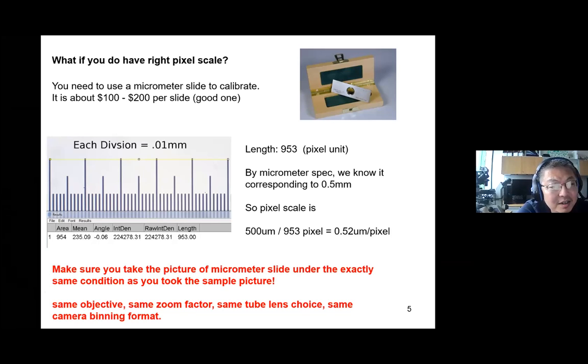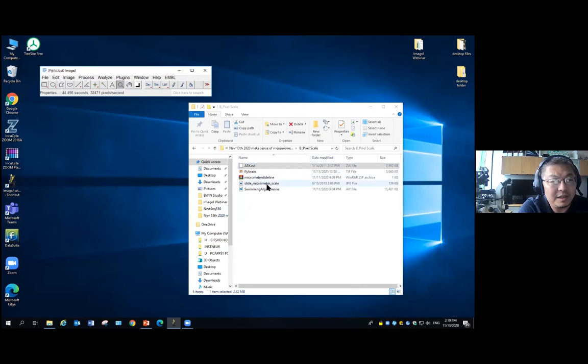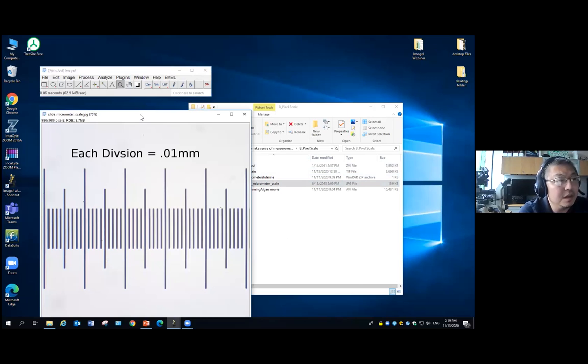Okay? And then you take a picture of this ruler. In this case, when we measure this ruler, all the measurements ImageJ gives you are in pixel units because we do not have any pixel scale information. But we know the physical length of this ruler, so we can calculate it back. So for instance, I buy this micrometer slide. I take it under my very old microscope and very old camera. I make sure I take the picture under exactly the same condition as when I took the picture of my sample.